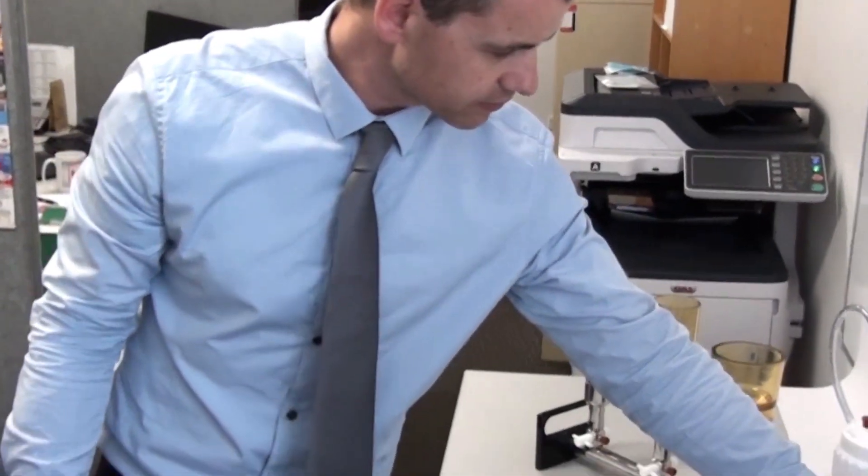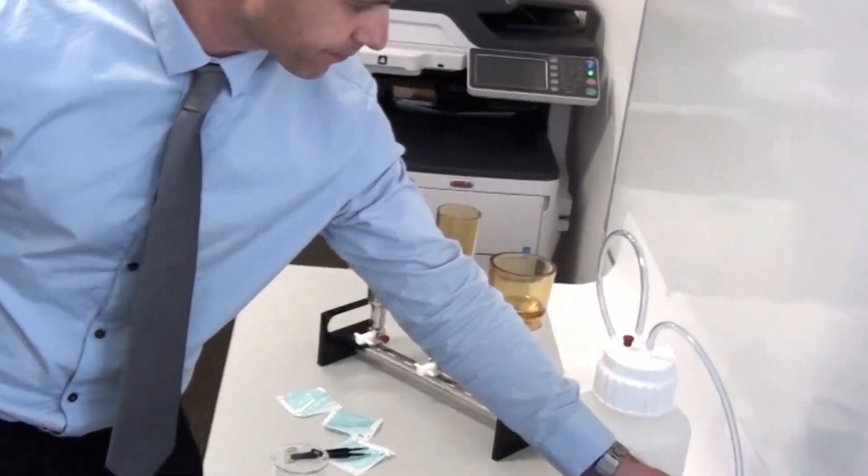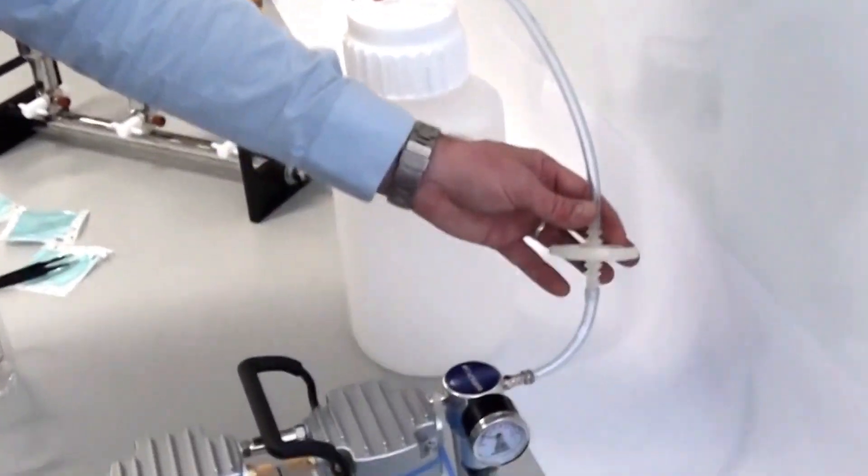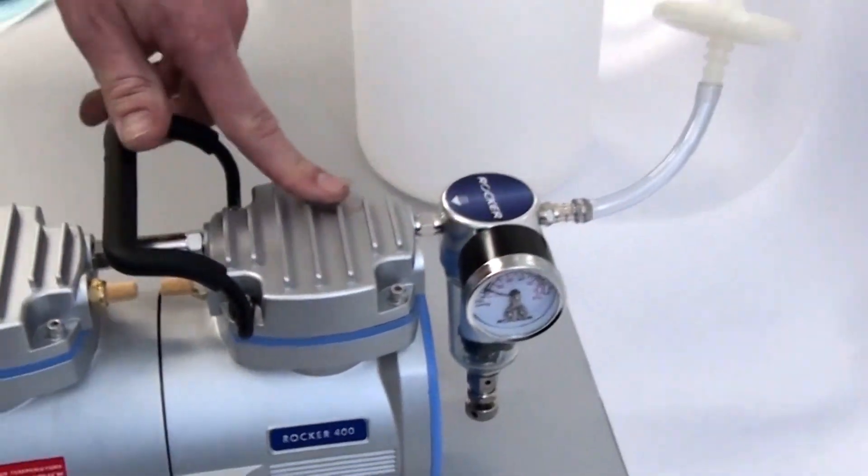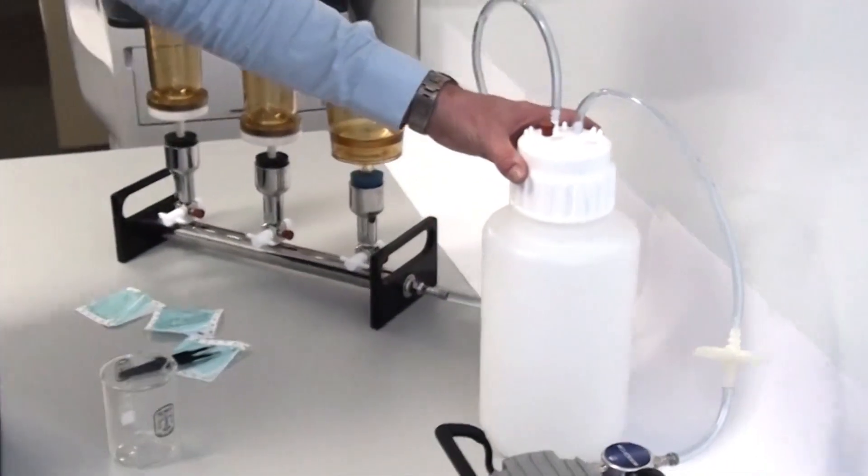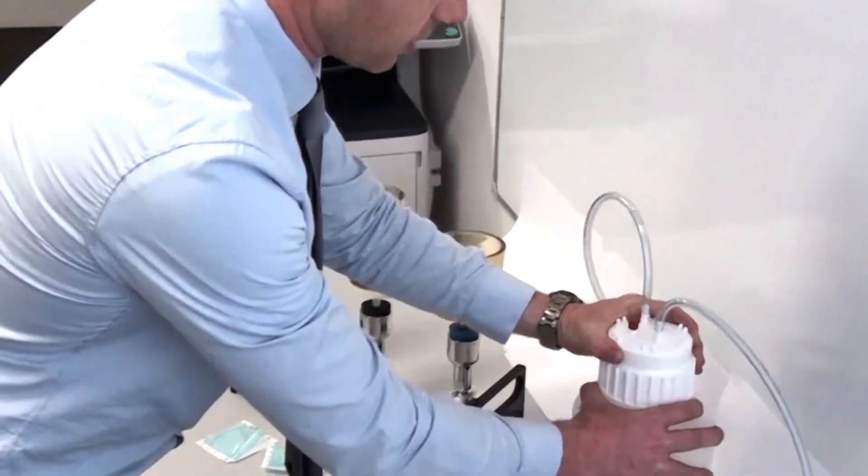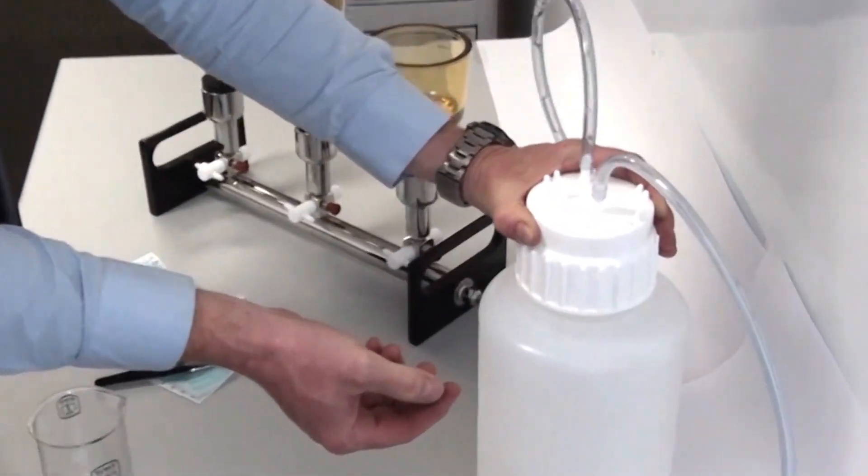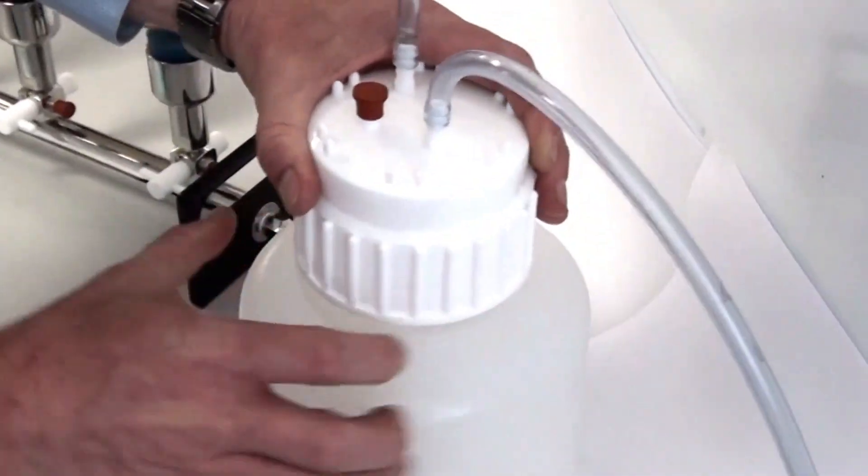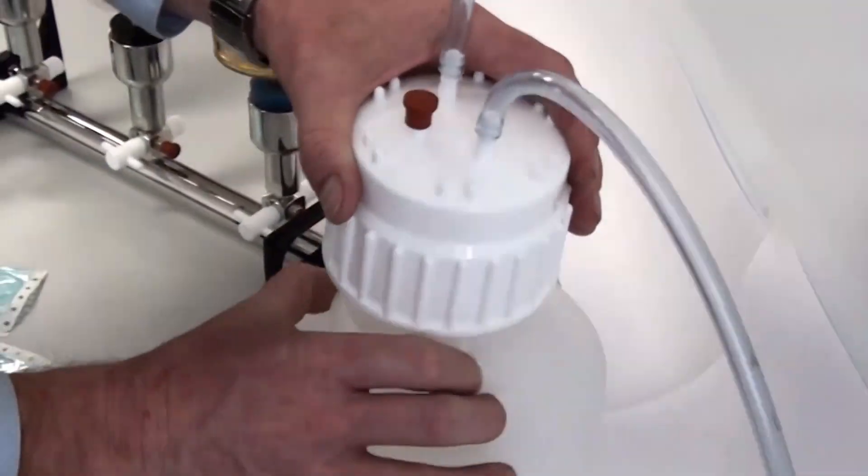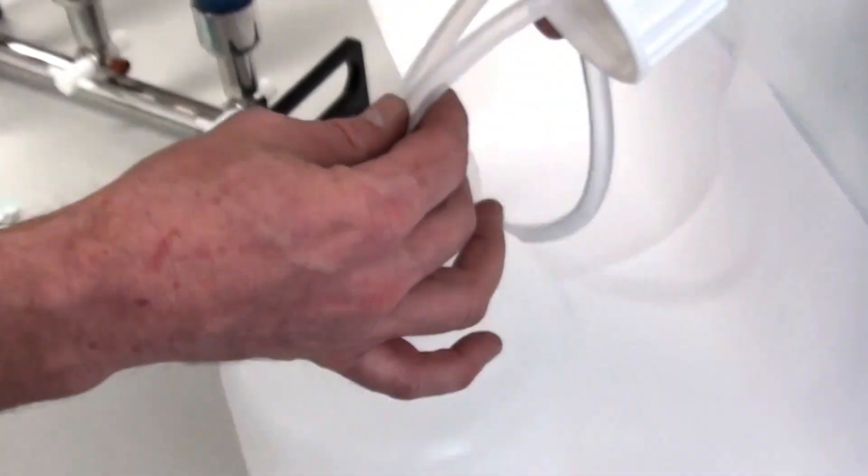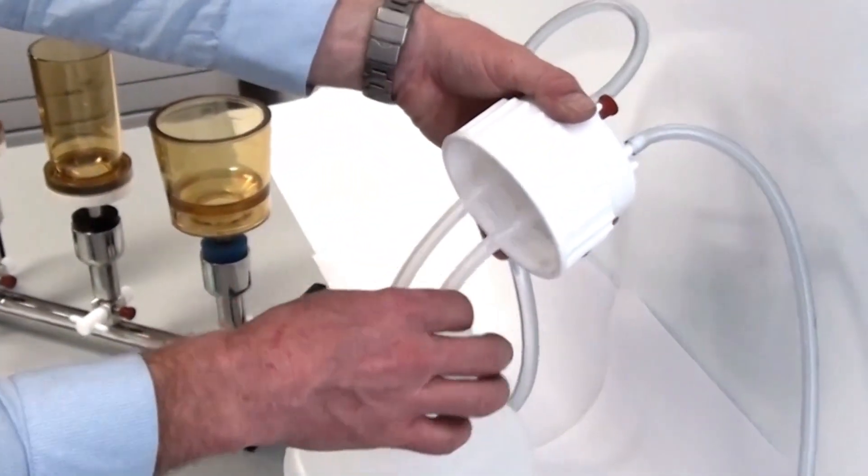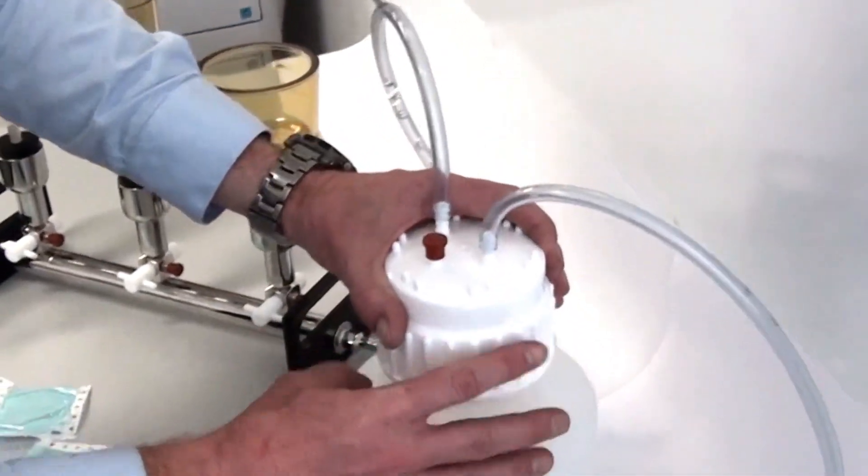So as you can see in this type of setup, it's probably, well, it is a great idea having this syringe filter, the 50 mil inline filter preventing water getting into the pump. As all the filtrate is collected here, I'll open this up. I'll release that pressure. So the liquid comes in from the left. And that tube goes all the way to the bottom. And the air, the vacuum is applied to this shorter hose. So you don't want any liquid coming through here.